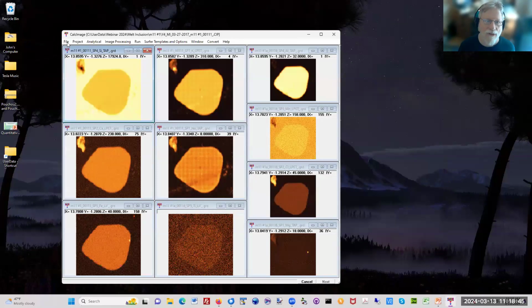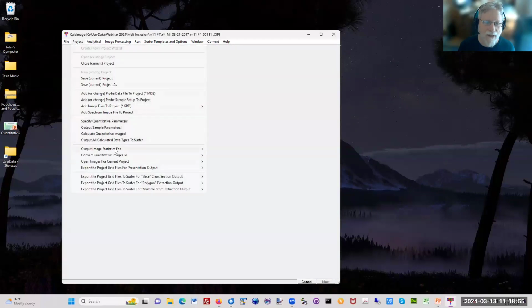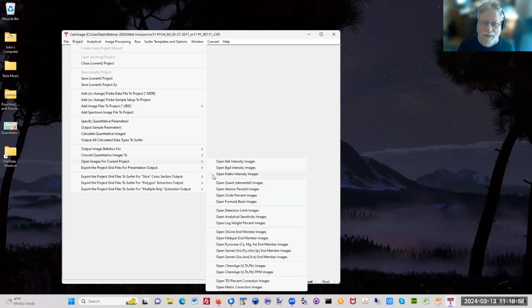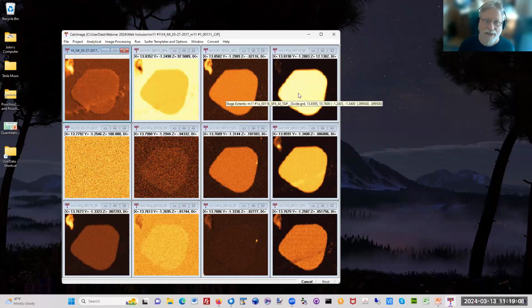Anyway, so when we go to the quant now, this is the raw data, so I'm going to close this up. And here's the raw data here. And by the way, I should point out that you can also do any of these. You can do oxide, you can do whatever you want. If I open the oxide images, here's the same data now, corrected for TDI, but now it's in oxide.